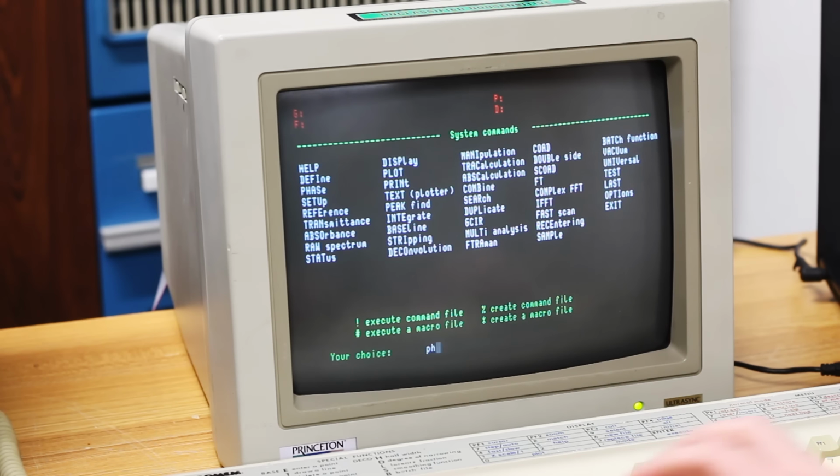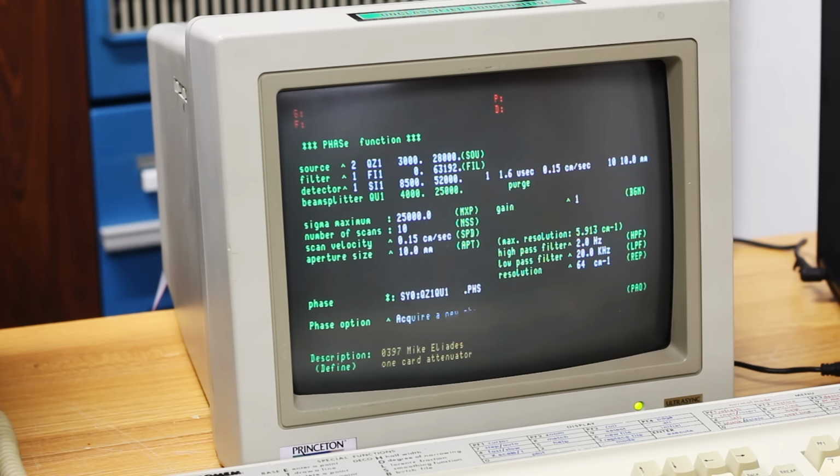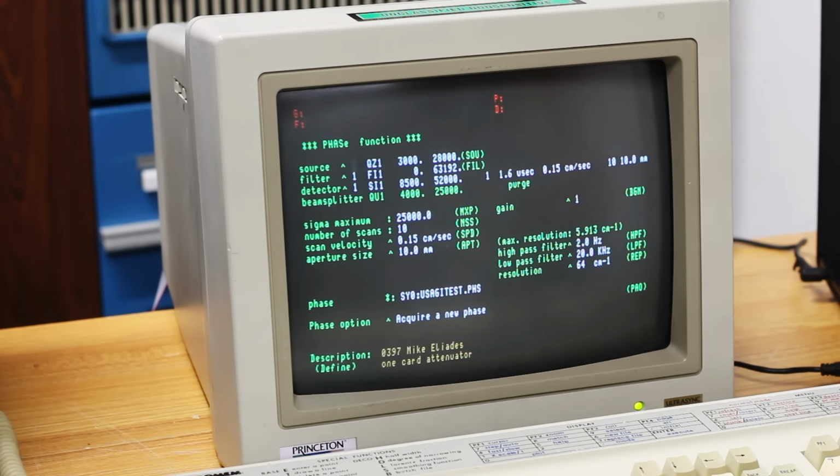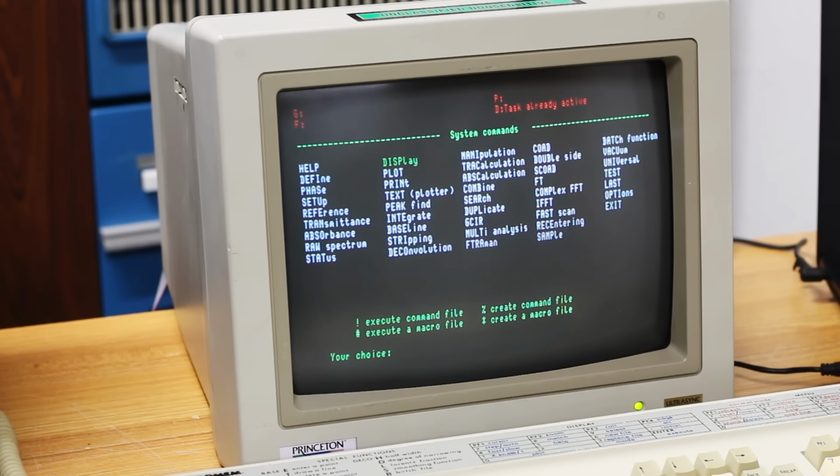Let's do a phase, okay. I don't know what any of this means. I am well out of my depth here. Let's just hit return and see what happens. It says task already active.